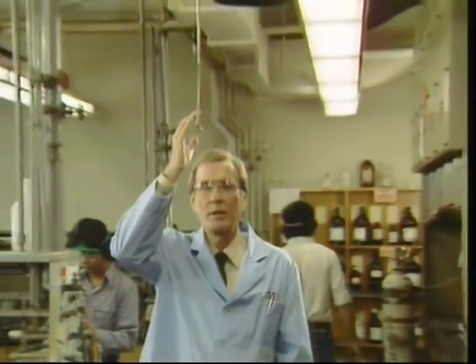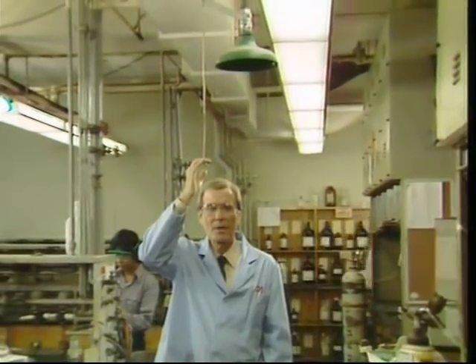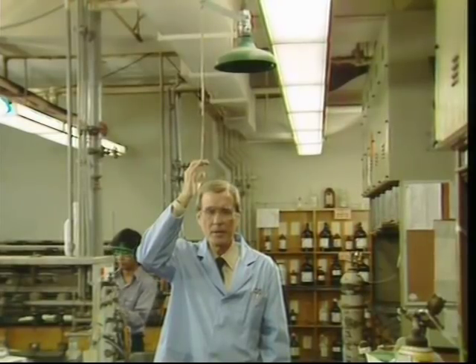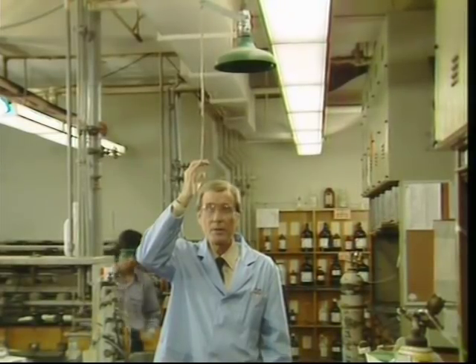The second piece of safety equipment you should locate is the safety shower. Discover where it is in the lab and how it works. The safety shower should be used to wash any chemical spill off the body if the affected area cannot be placed under a regular water faucet or tap.